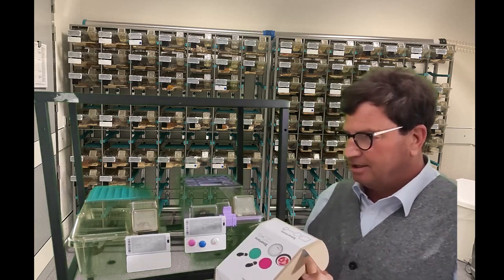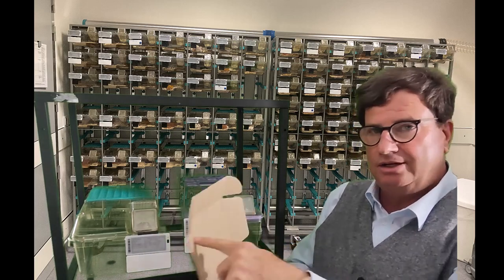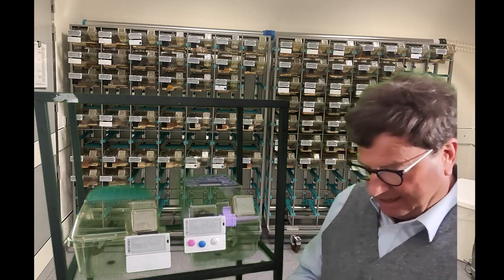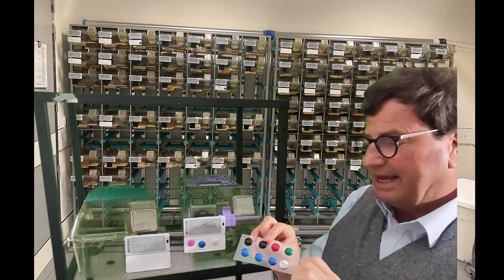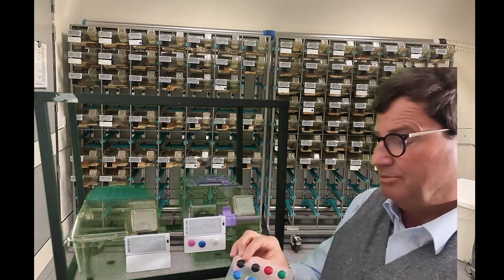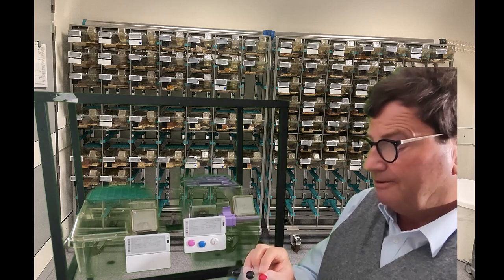So the buttons are provided in a box on foil, and always 16 on a foil. Just let's take that away. And the different colors mean different states of the cage. So blue could be cage overcrowded, black, dead animal found, red, sick animal found, and green may be litter found.